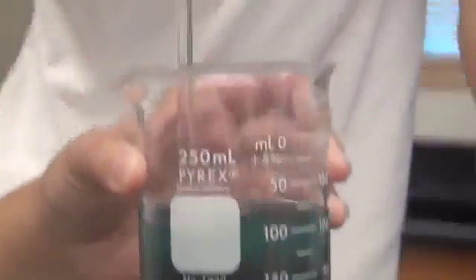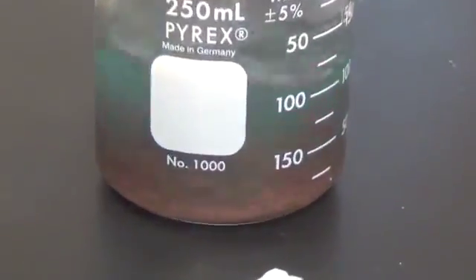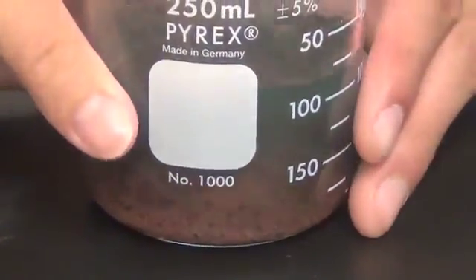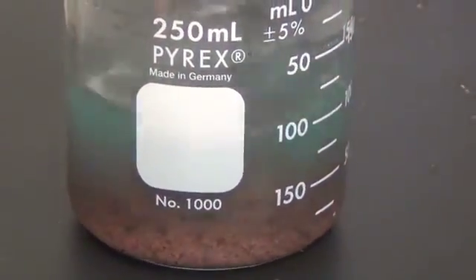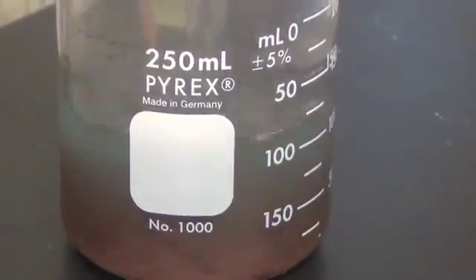And the solutions are getting close to clear. It's really hot. It kind of looks like brown beef. Yeah, this worked a lot faster.